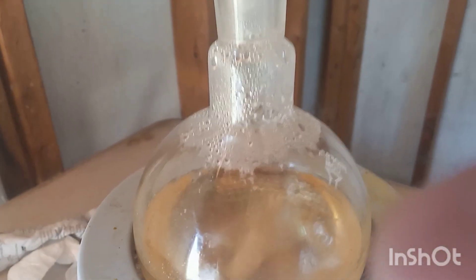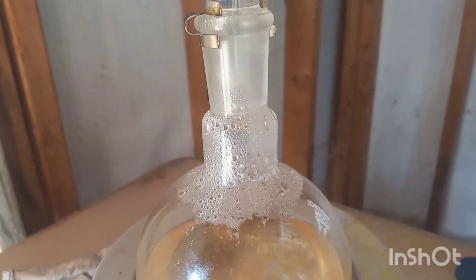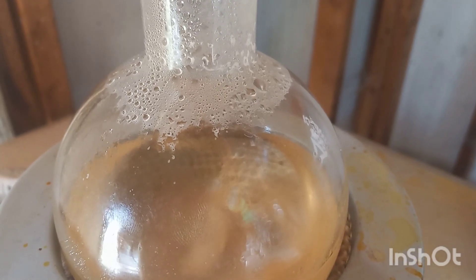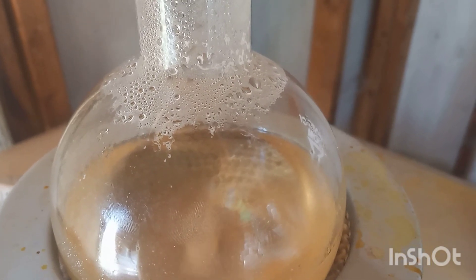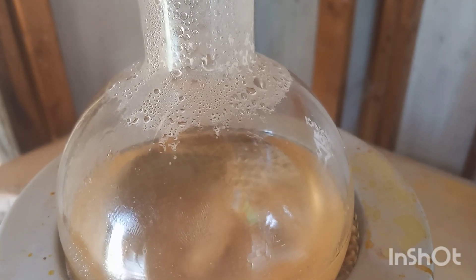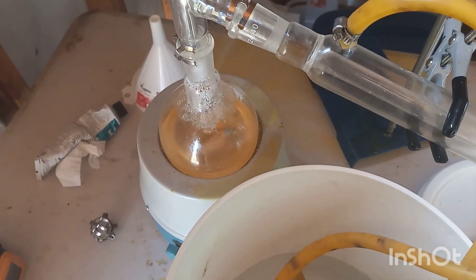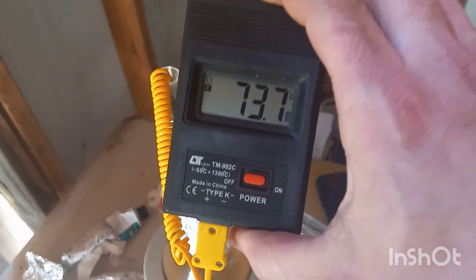Right now we've got things set up for distillation. I only put about an hour worth of reflux into it. I'm basically just at about 60 degrees C on the outside, so it might be about 70 or 80 on the inside. We're going to let this slowly come up and see what the thermocouple says when it reaches the condenser. Hopefully we'll end up with some pure butylamine — by distilling as it forms, we're pushing the reaction to completion. I think 10 or 15 mils should be about what we should expect. The boiling point we're looking for is 76 to 79 degrees C.